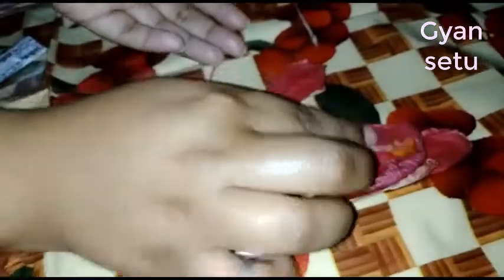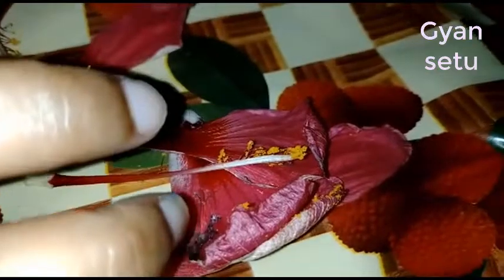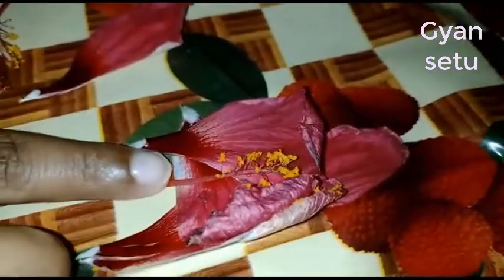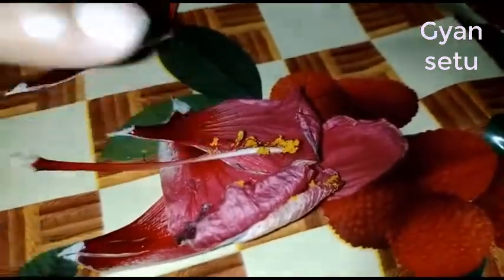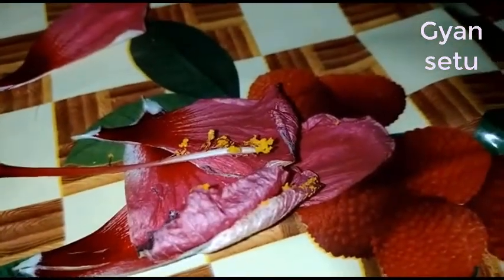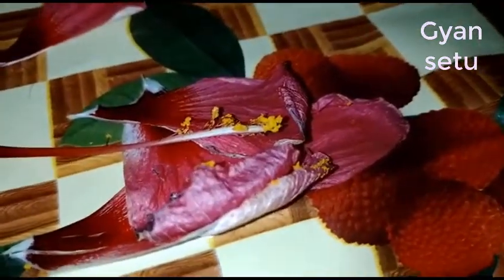These are the petals and your pollen grains. The male reproductive system consists of pollen grains, which help in pollination and reproduction by forming male gametes.